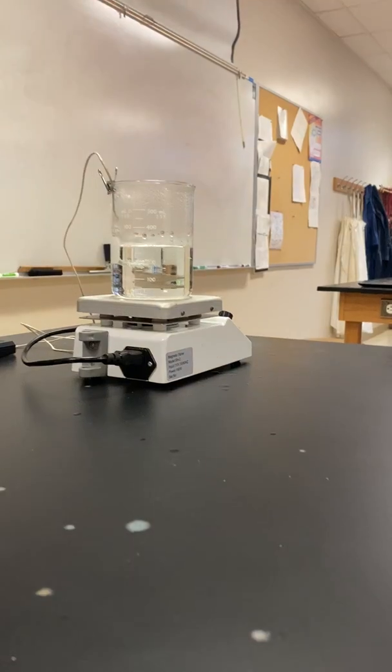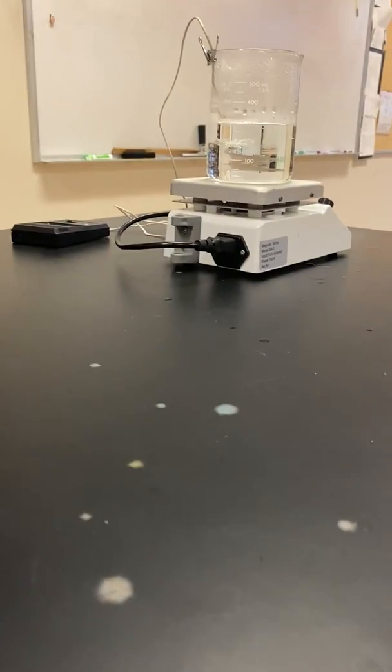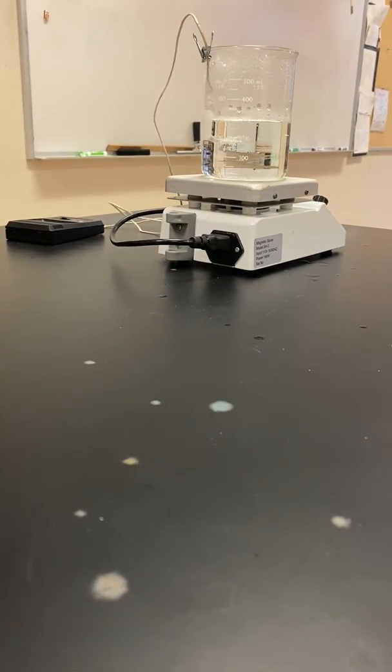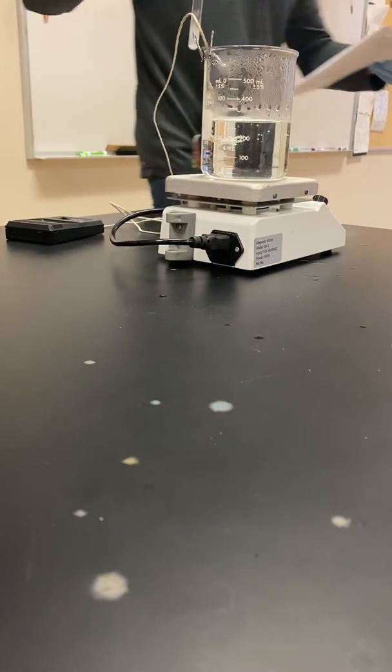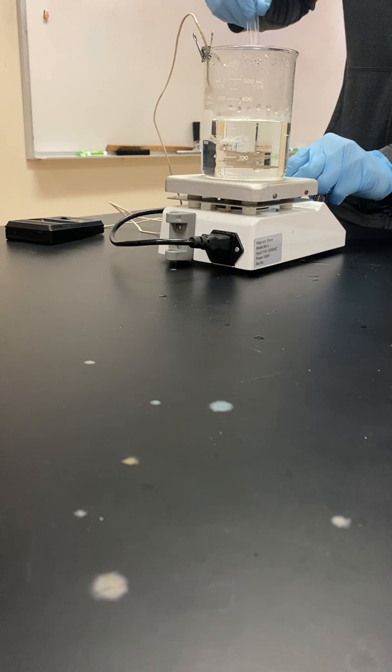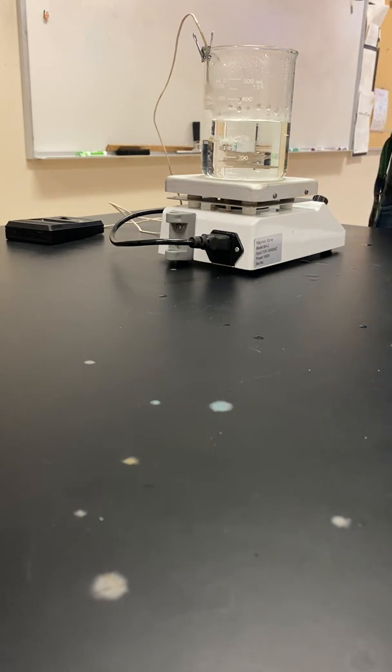So I'm just going to move you over here once again to the hot water bath. While we wait on these to dissolve in this hot water bath, this test tube became extremely cold. So I'll need you to tell me whether or not that's endothermic or exothermic.